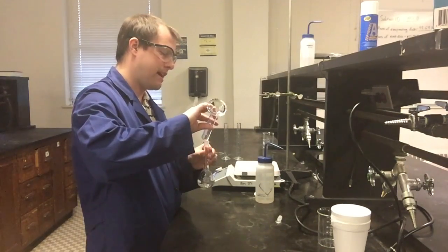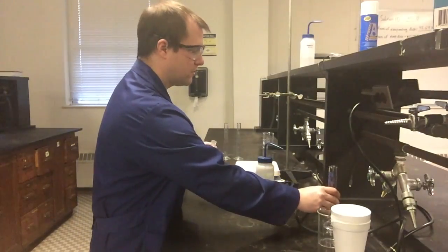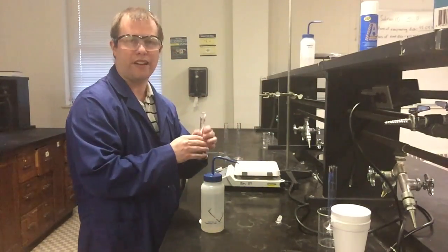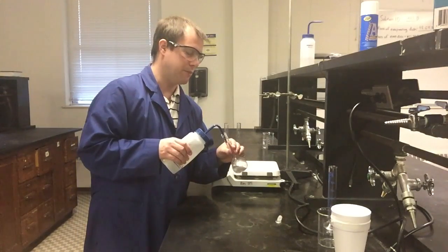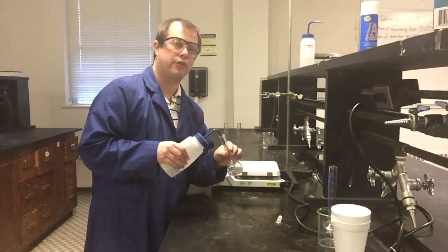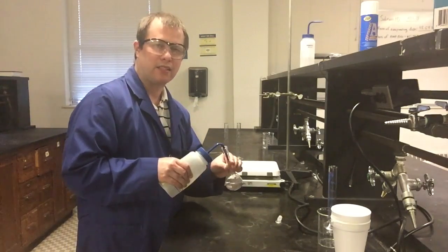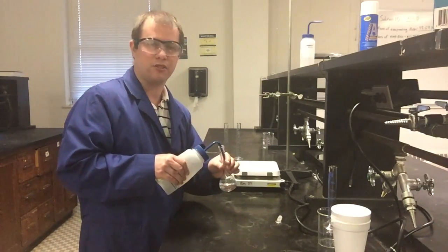And similar to past times when I've made solutions here, generally when we're making our solutions, what I'm going to do now is fill it up with water, not all the way to the line on my volumetric flask, but somewhere just kind of close, like at the start of the neck usually. And then I'm going to stir the solution up and mix it together very well. The purpose of that is just to make sure we get everything thoroughly mixed before we get our solution all the way full and expect it to be exactly the perfect volume, because when we mix it, that volume might change ever so slightly.